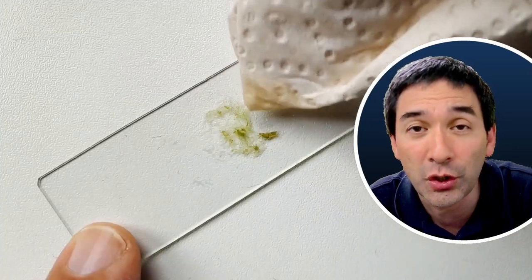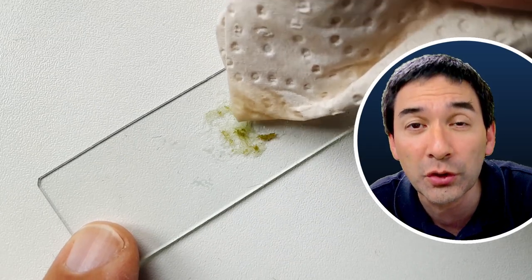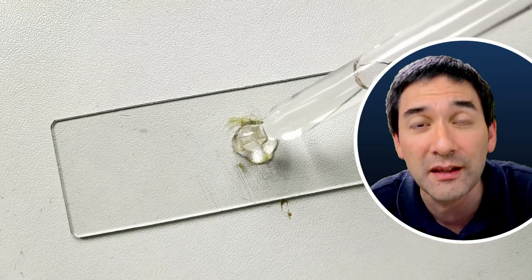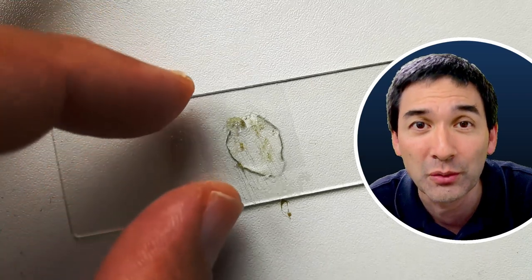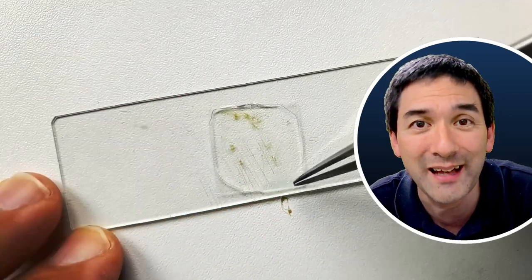Now I put the algae on a microscope slide. I removed any excess water but did not allow it to dry completely because the glue is water-based and therefore it is compatible with specimens that also contain water. So I simply added a small drop and then I added a cover glass.